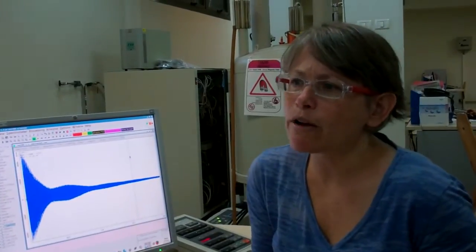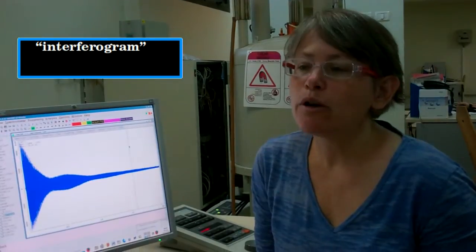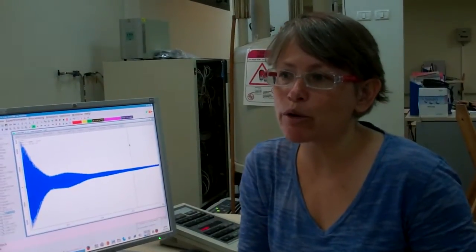And we know from our acquisition parameters, as seen in the last video, that AQ, the acquisition time, was set to 2 seconds. The FID is an interferogram, which reflects the sum of all the peaks and all the troughs of all the individual proton signals that we recorded. Every set of protons with the same chemical environment will have the same precession frequency. And likewise, every set of protons with different chemical environments will have a different precession frequency.